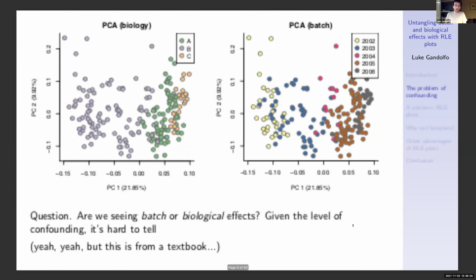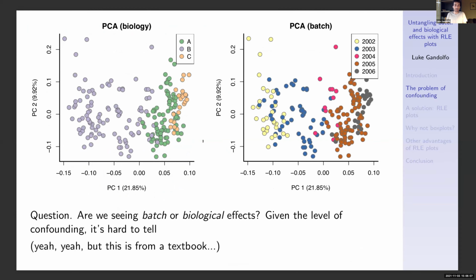Okay, so let's make 2 PCA plots, one colored by biology and another colored by the batch variable, in this case, year of processing. So hopefully now you can start to see what the problem might be, because the question is, are we seeing batch or biological effects in these PCA plots? In other words, what's driving the separation of the samples along the first principal component? Is it biological effects as seen here, or is it batch effects as seen here? Given the high level of confounding in this data, it's very hard to tell from the PCA plot.